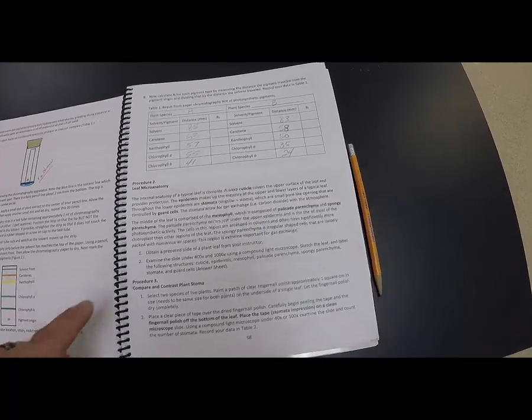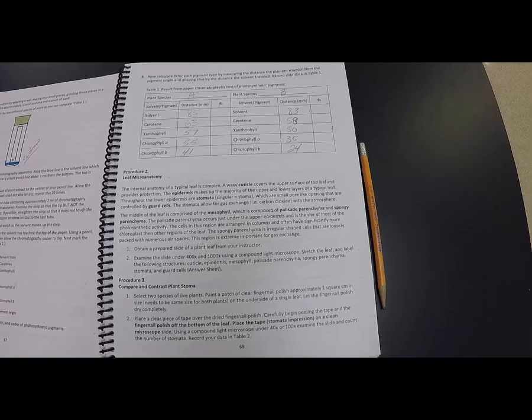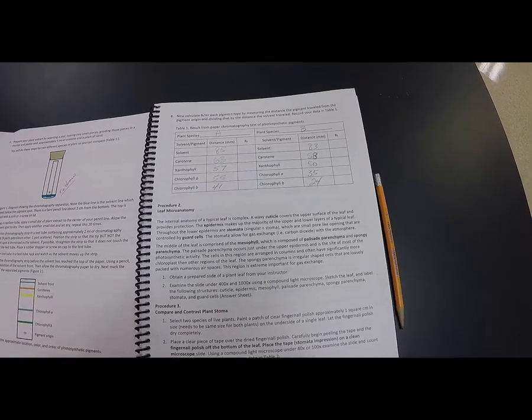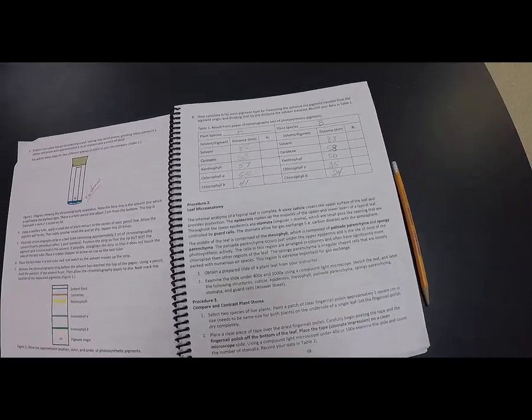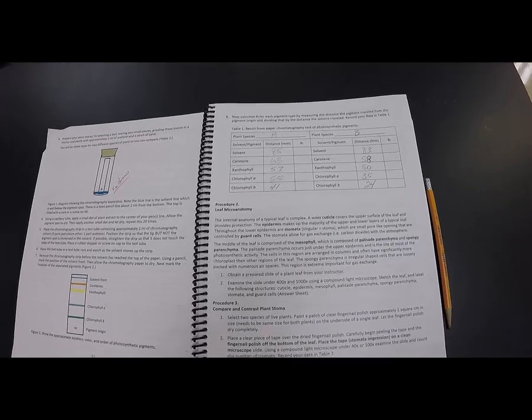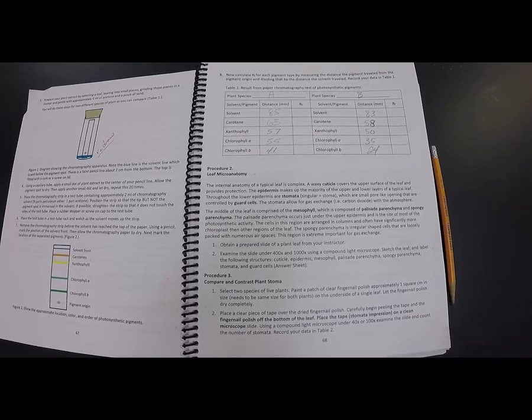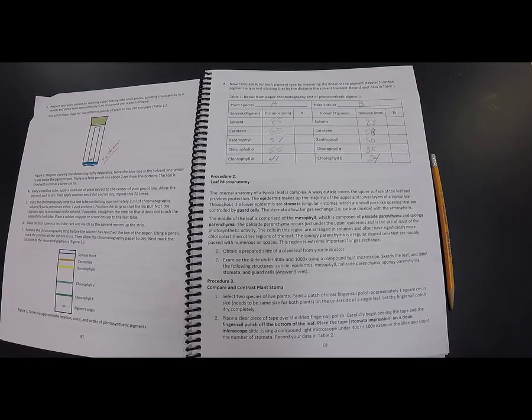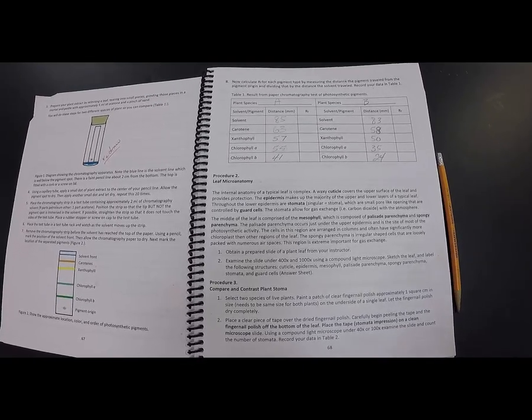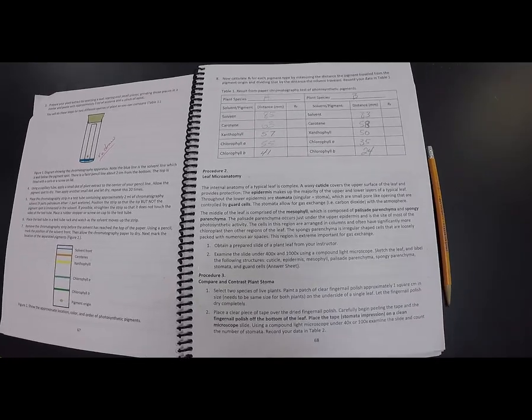The next thing that I'm going to do is demo the leaf microanatomy. So that video is coming. That video will be kind of an interesting video. It'll be a picture of me looking through a microscope, but then I hopefully will get up a live video of the microscope, me scrolling through and talking about the different pieces in that leaf microanatomy.